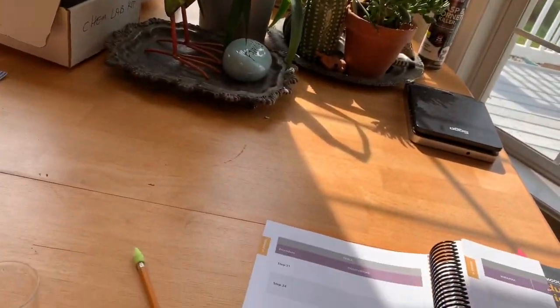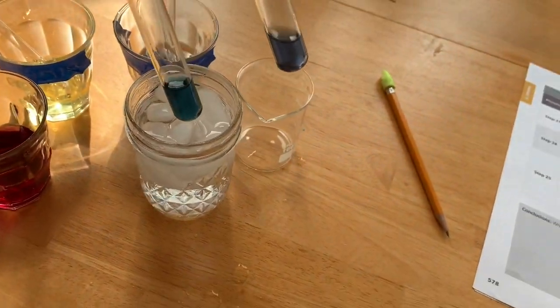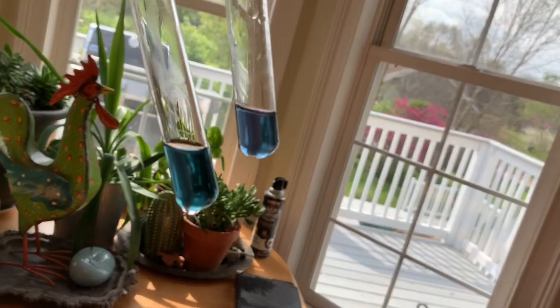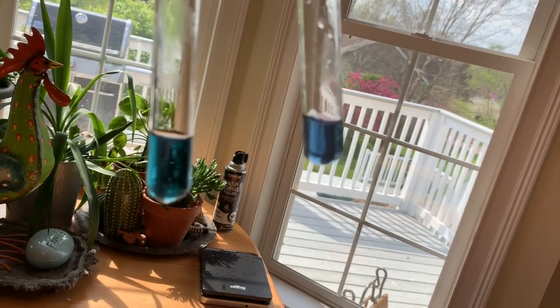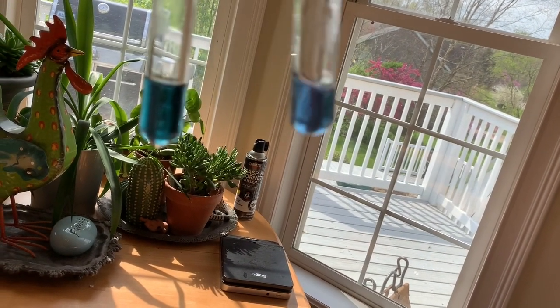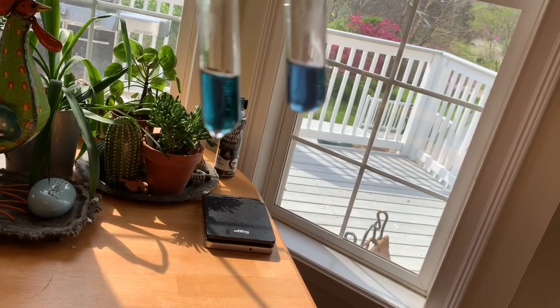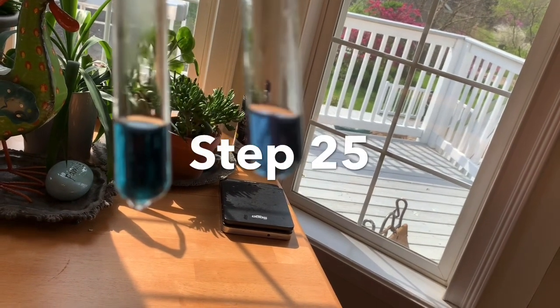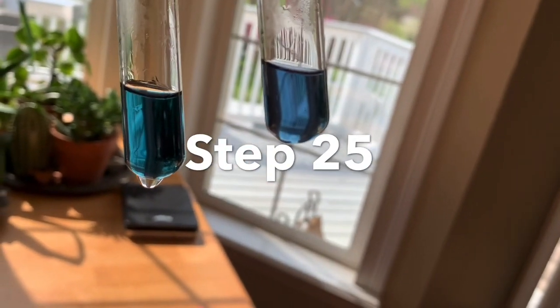Okay, so here's our hot. We'll get the cold one. So here's our hot, here's our cold, and yep, we have a distinction. Here's our hot one, there's our cold, and it's bluer. I think it's getting a little bit lighter because we've been messing with it. So that's a good look.